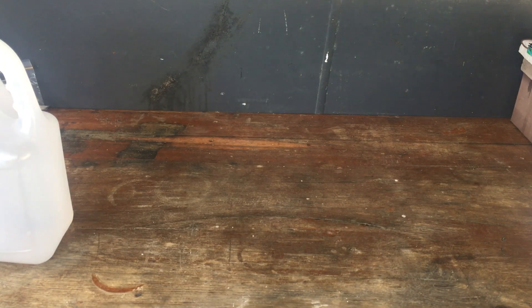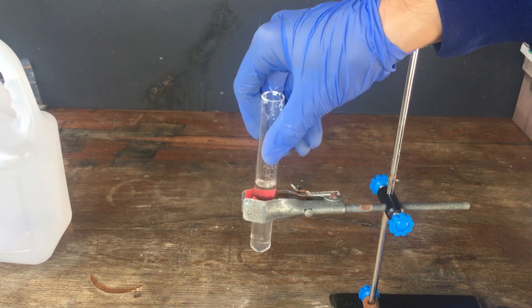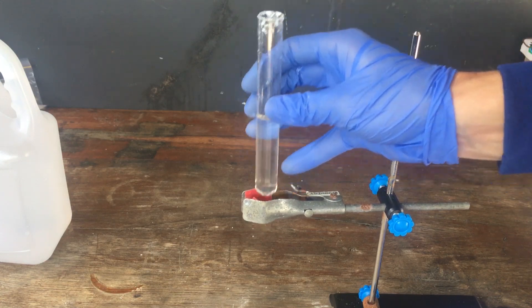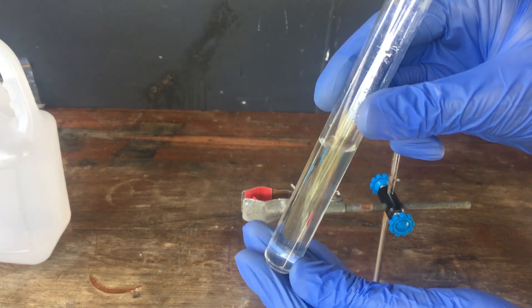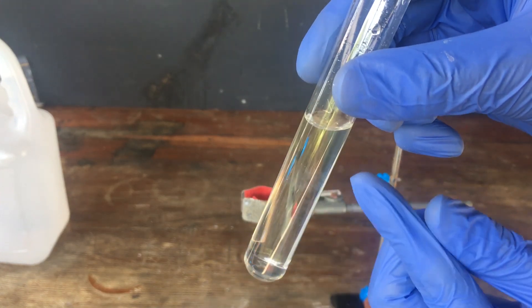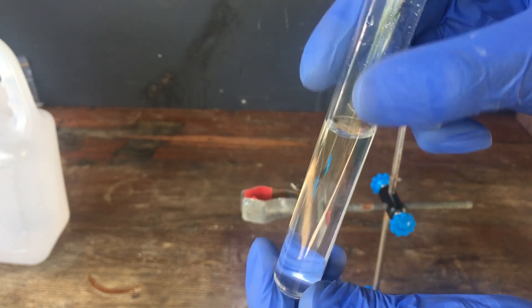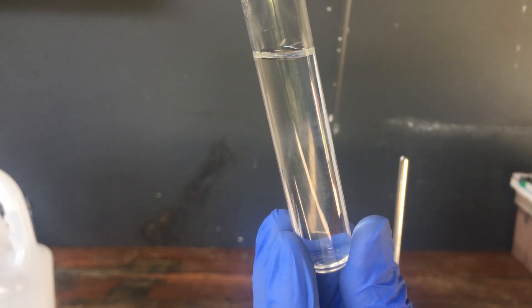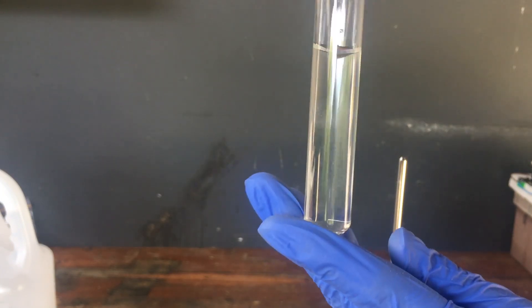In fact, if we work hard enough, we can even see this lead. What I've done here is reacted a small amount of sulfuric acid with some sodium carbonate. The sulfuric acid reacts with the sodium carbonate in an acid-base reaction, and once we've added an excess of sodium carbonate, you can see — if we get a good look here — there's just a small amount of milky suspension right there. That, I believe, is lead carbonate. You can just see it in there floating around. It's not much, but it is significant in a lot of cases.